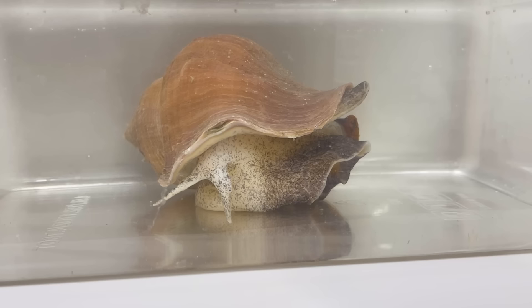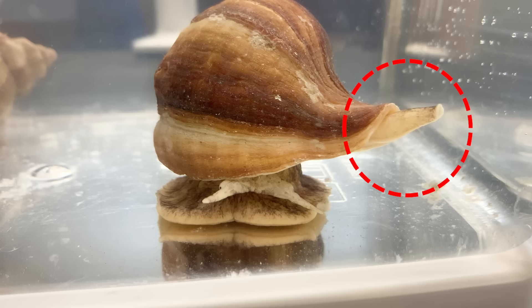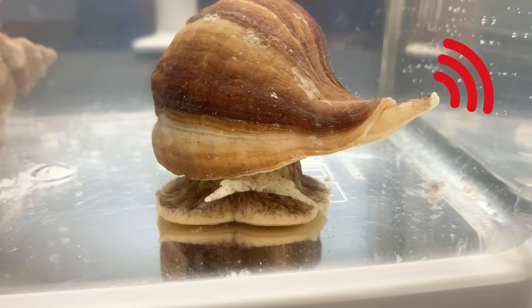All species of whelks share a similar appearance underwater. One notable difference between whelks and land snails is the presence of a siphon. This siphon allows them to breathe by drawing water into the shell, and also helps them sense chemical cues in their aquatic environment.